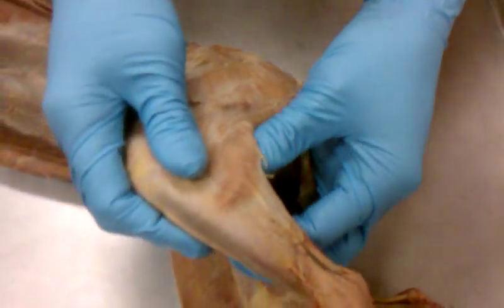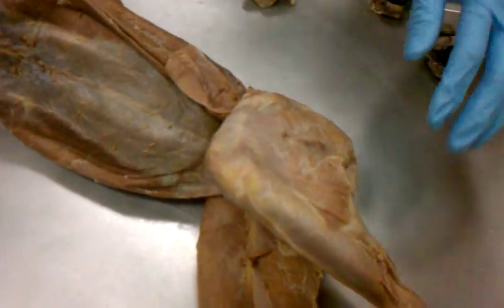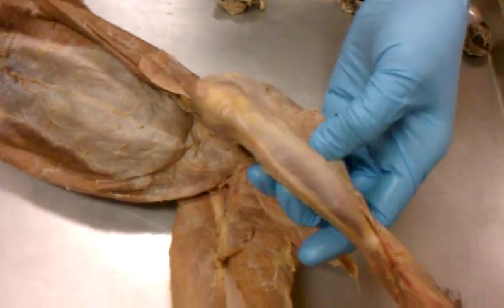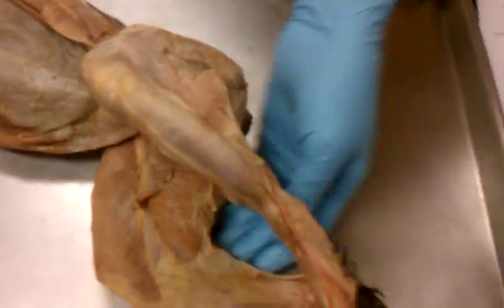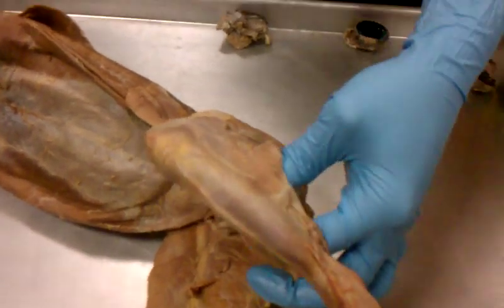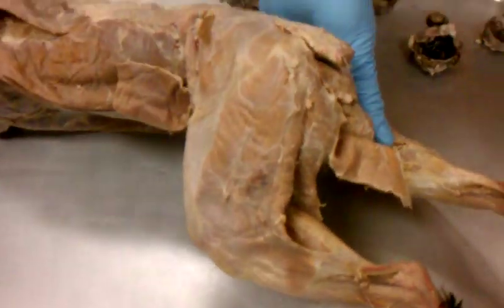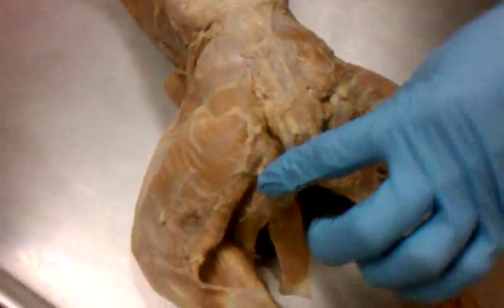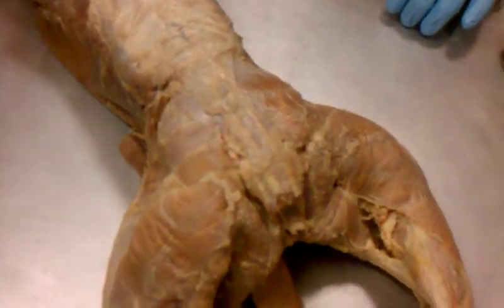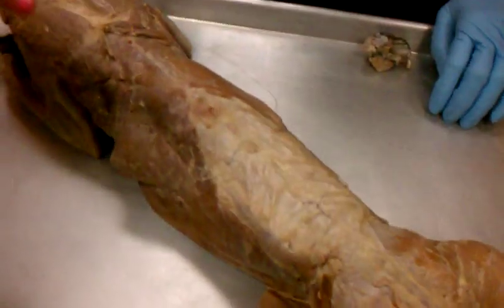And then what's this calf muscle? Is that the one that helps you prevent shin splints and stuff? That's the one that will rip away. And then what is this big chunky one right here? That's the gastrocnemius. Yes, your calf muscle. And then I think the only thing we missed are your glutes back here. This guy's a really poor example of glutes, but that's just me.